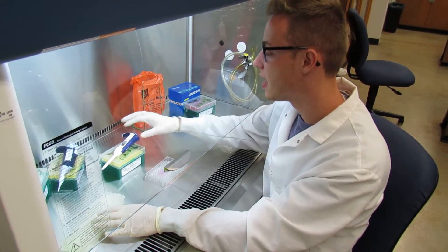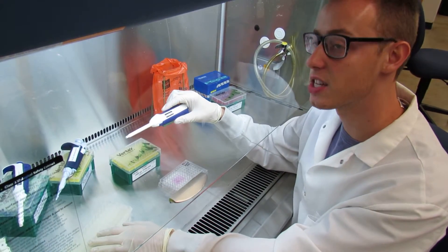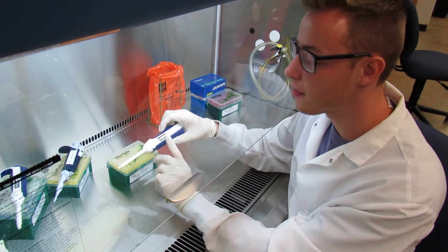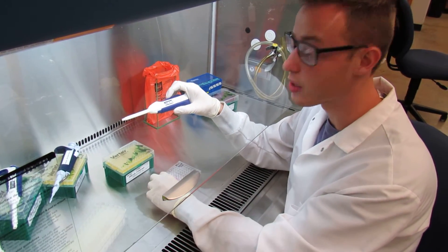So what you will do is you will take your 200 microliter barrier micropipette and you'll set it to 25. You'll be adding 25 microliters of your activated XTT dye to each of your wells.